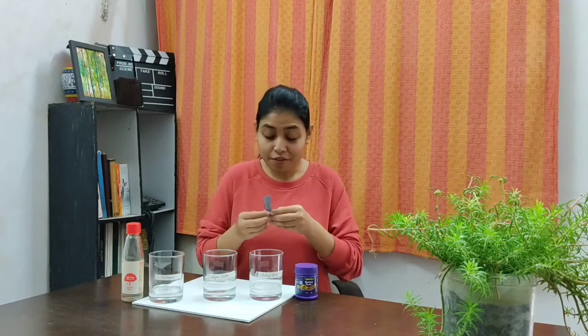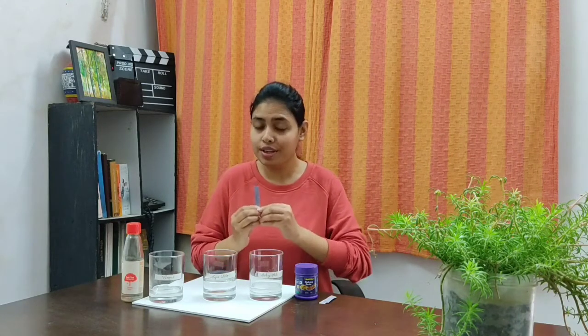Our hibiscus paper strip indicator is ready. Now let us perform the experiment. First, I am going to dip the hibiscus paper strip in a basic solution, which is baking soda solution.